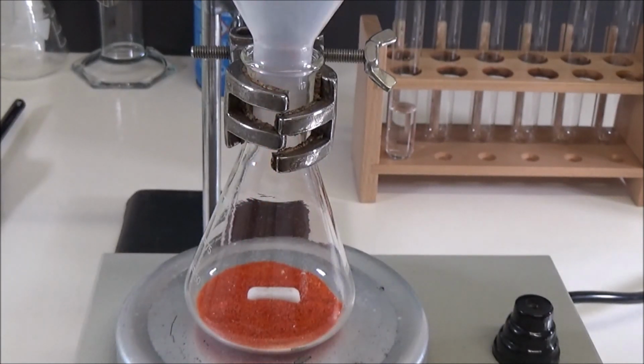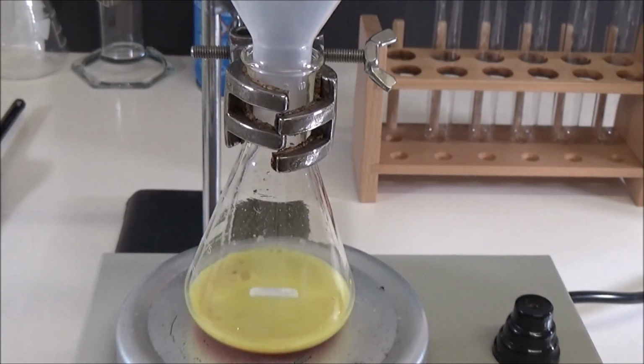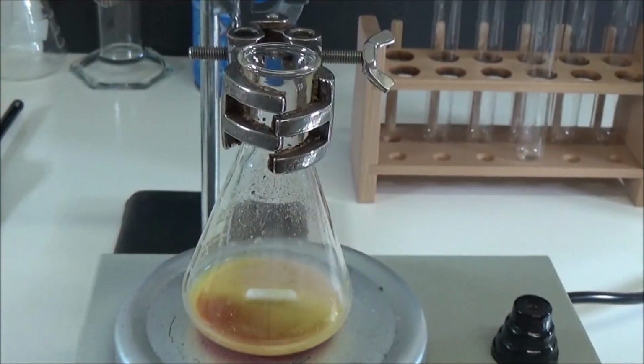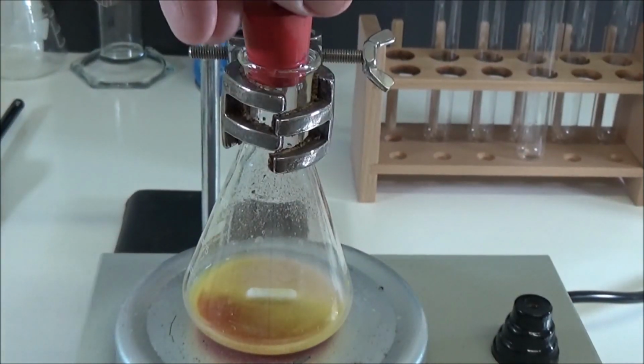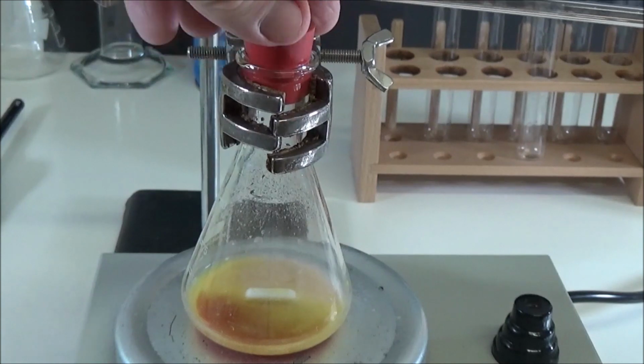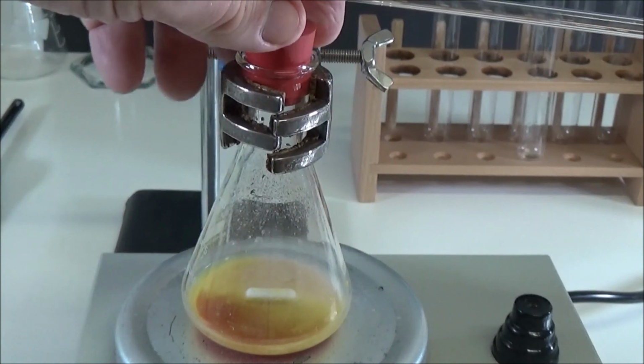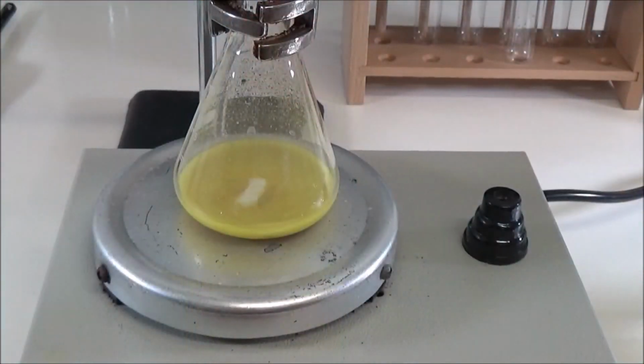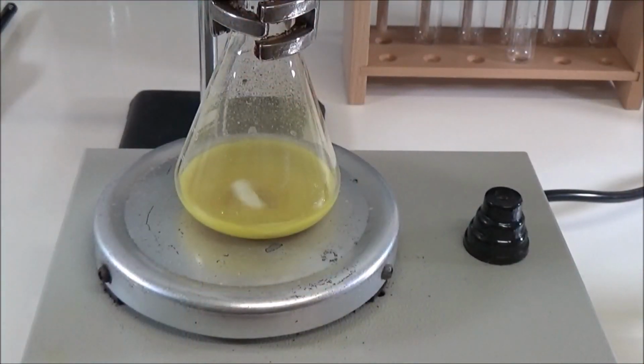When the water was added, gas was formed even in the cold, which increased even further when the mixture was subsequently heated. After the onset of gas evolution and before the start of heating, the flask was closed with a single bore stopper into which the angle tube for gas drainage had previously been screwed. The mixture was stirred magnetically to prevent bumping or foaming over.